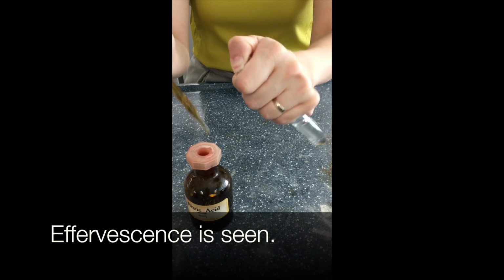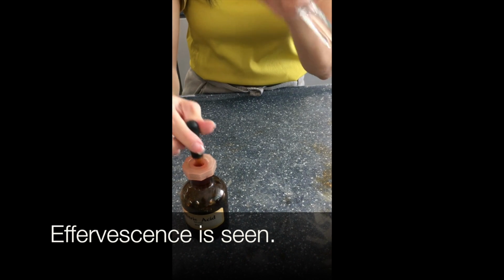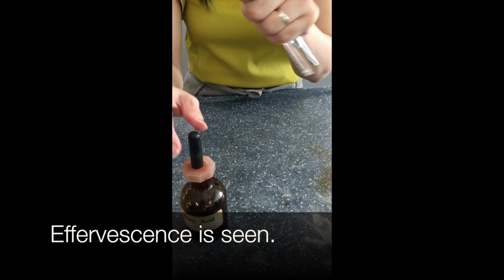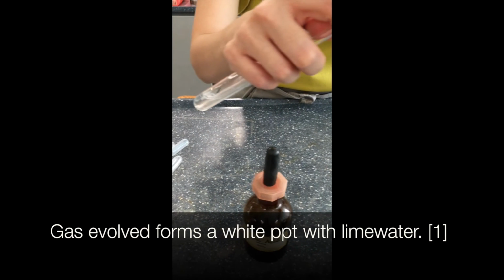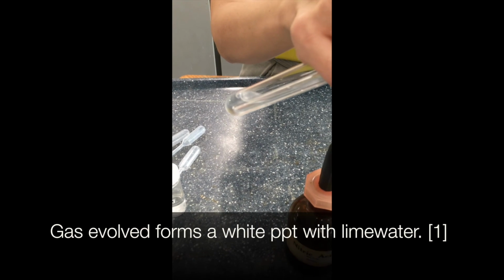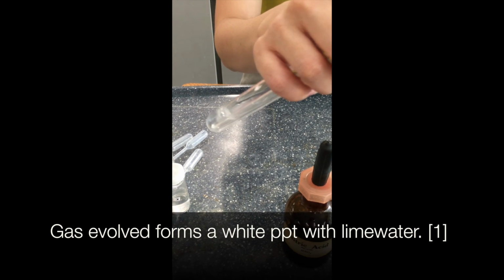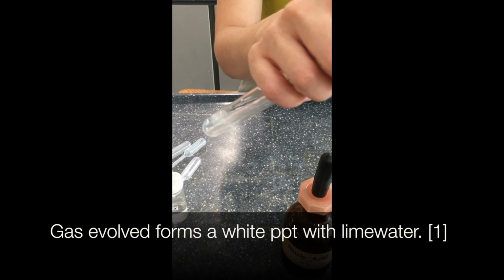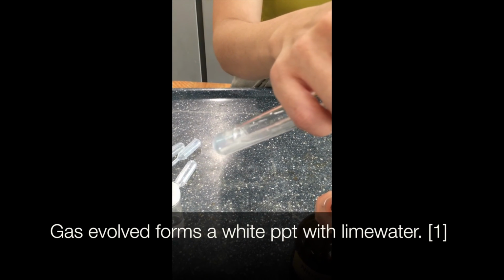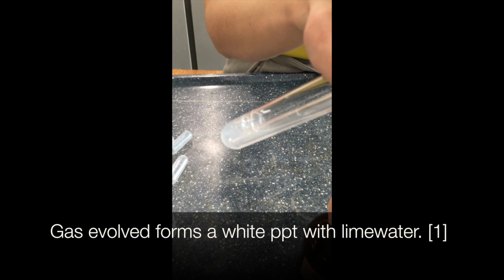Once we trap most of the gas in the test tube, then we can use lime water to test. So we are adding until no further change as well. And when you look at lime water, we are looking out for white precipitate. With all gas, we have to be patient. And here you can see that white PPT is formed.